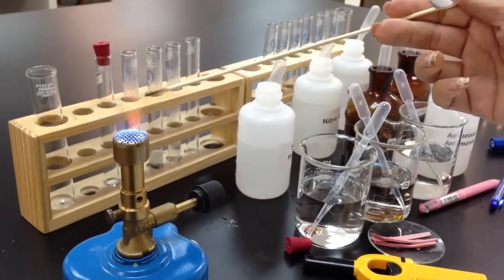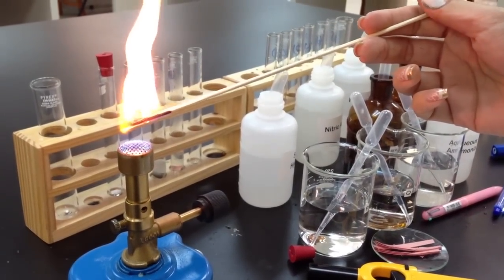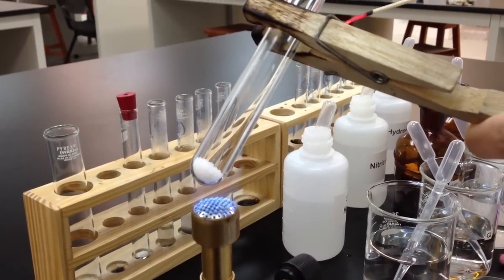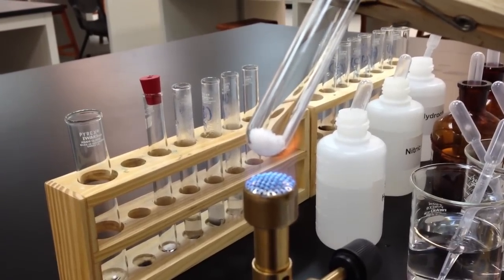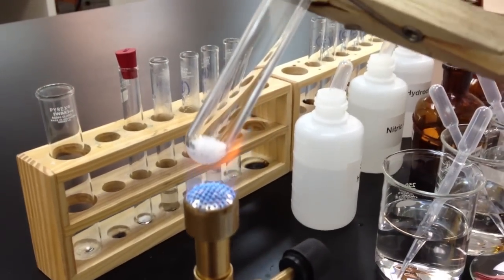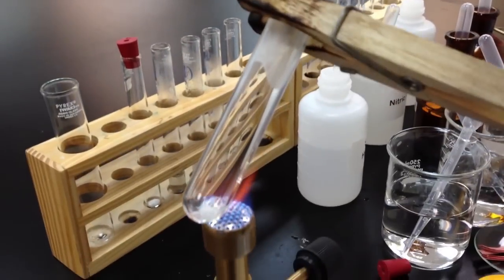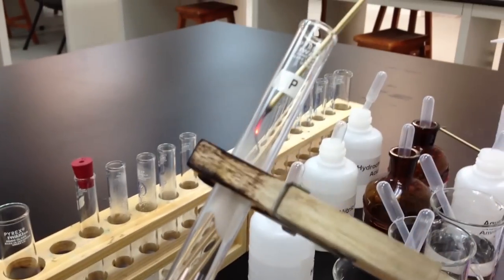They say I'm going to use a glowing splint, so let me prepare by using a lighted splint first. I let it burn. And this is P, so let me heat it gently first, and then strongly. This is a glowing splint — I place it at the neck of the test tube. I can see from here that P slowly melted and is turning to a colourless solution.